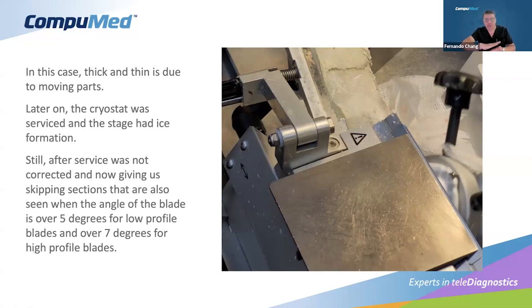This is a low profile blade, by the way. We have high profile and low profile blades. They behave differently too. And then we had to adjust the blade angle, also related to the blade. High profile blades need a little more angle, maybe 6 or 7. Low profile blades, we prefer 5 or 6. Okay, this is something important to note as well. In this case, we usually use low profile. We like that.